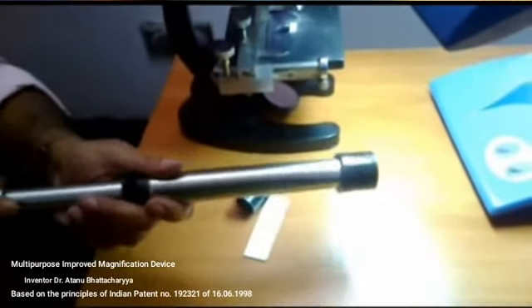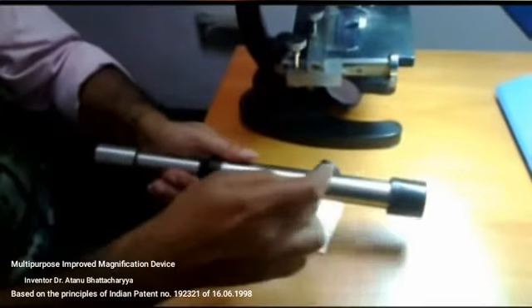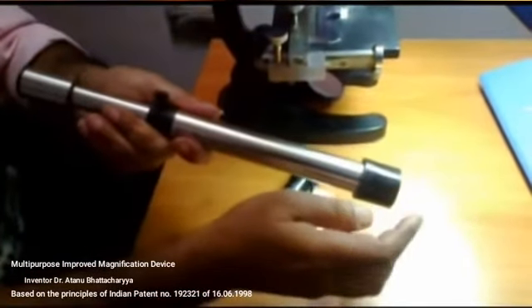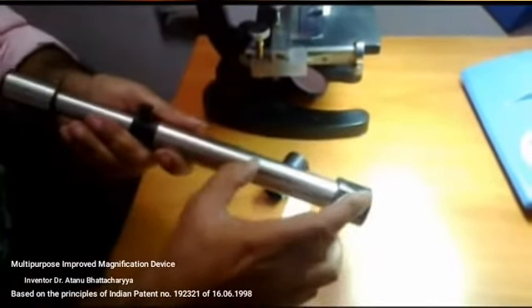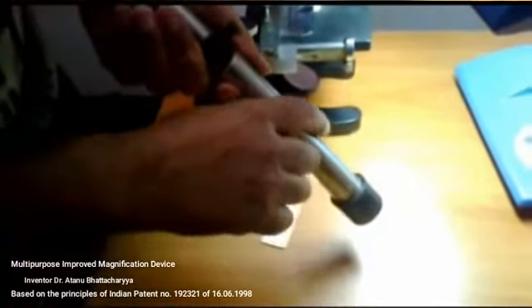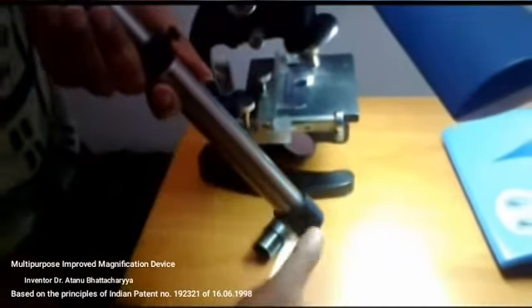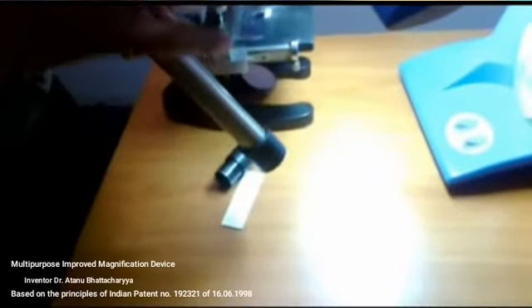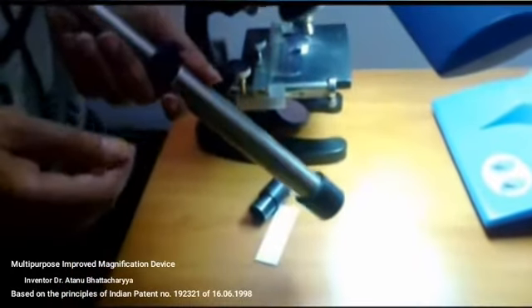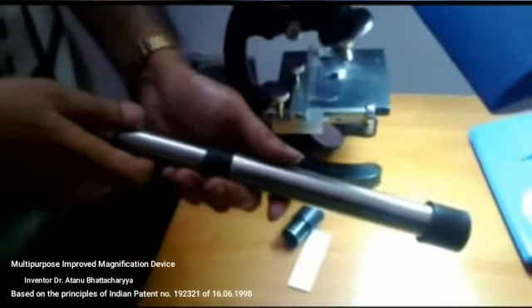Now, if we want to reduce it, then I have to push this tube. Now this objective will form the image at a lower position. At the lower position means then I have to adjust it, and for the adjustment, the object distance and the length should be increased. So this distance is increased, this distance is lowered, so the magnification becomes lowered and the total magnification is low. Now when it is used as a field microscope, then what happens?